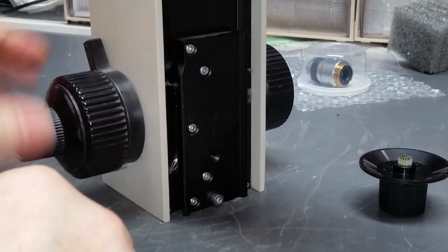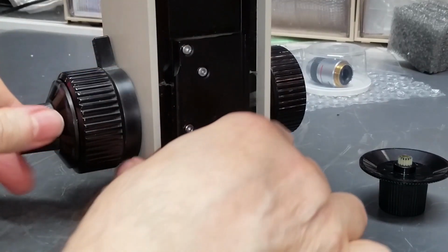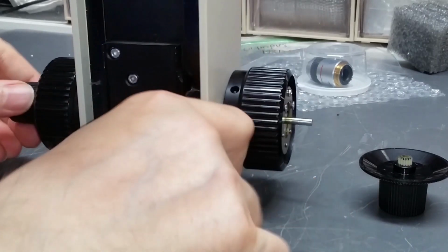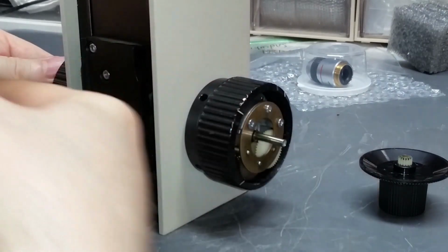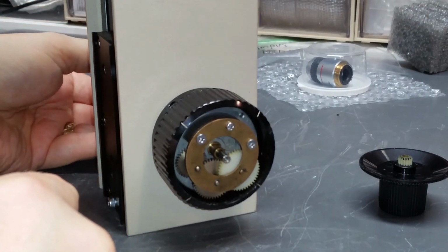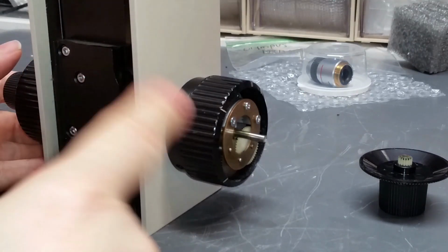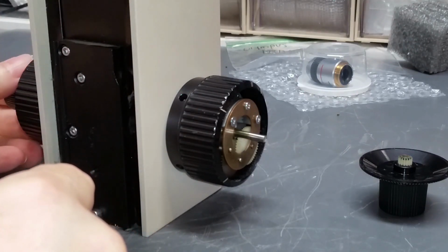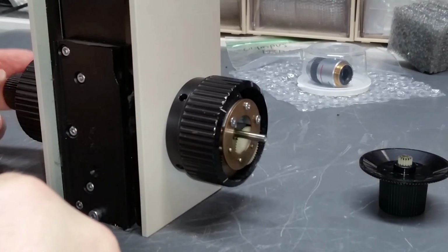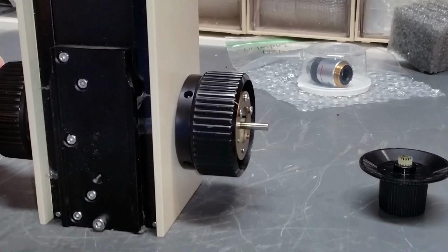Ordinarily, if this were a scope that was in decent shape, I could grab this knob and pull the whole shaft out, but I can't really do that in this case. It gets really tight down. The reason for that is because that bent shaft doesn't really want to go through that hollow brass tube that it's in. It wants to catch because it's bent. So what we're going to do is we're going to try to take that bend out of it for two reasons. One is it allows me to take it apart much easier without damaging the mechanism inside there. And number two is it'll be straight when we're done, and that's definitely better than having a knob that wobbles a lot. So let's go ahead and do that.